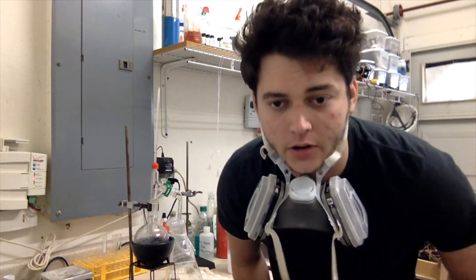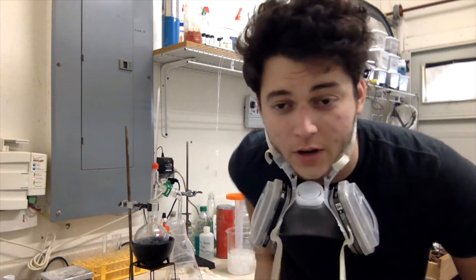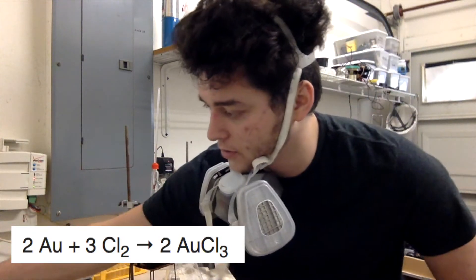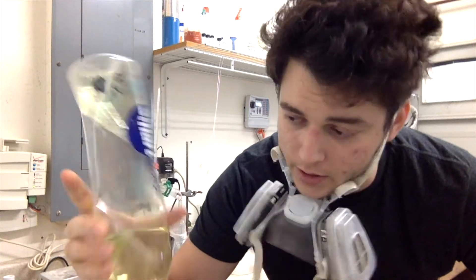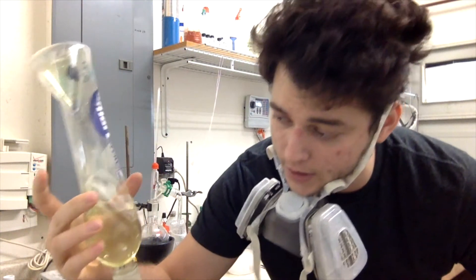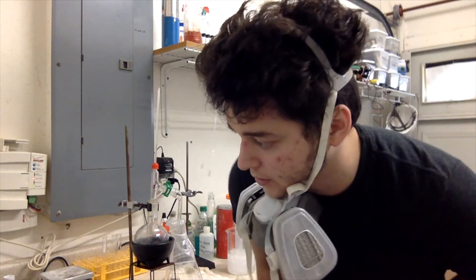Since last time I did a crude method of making chlorine gas, I decided to get a little fancier to make some chlorine gas without water contamination so I can use it to react with gold. Last time my result ended up with the liquid getting kind of yellowish, some gas trapped at the top, but because I made it with a water bath and kept water in there, after I froze it and shook it up, it dissolved into the water. I think it reacted with water and made hydrochloric acid, which is not very good for what I'm trying to do.